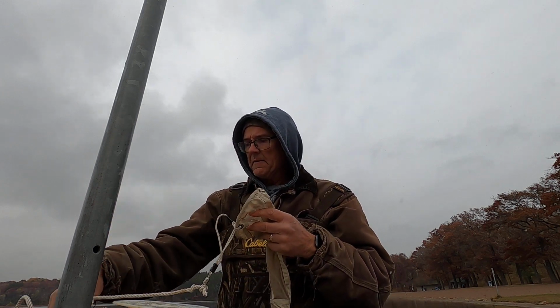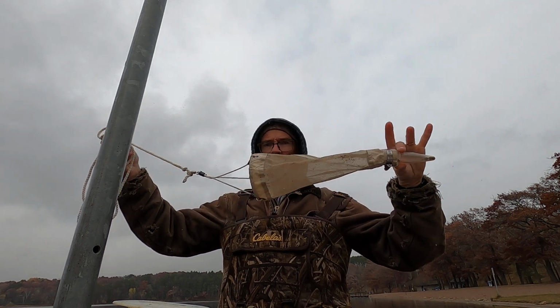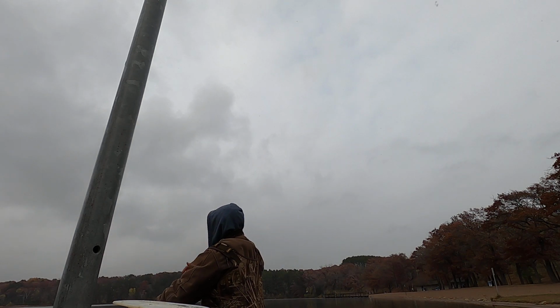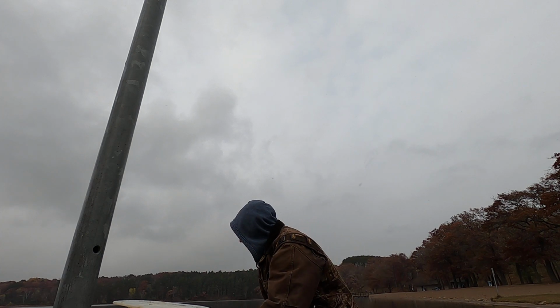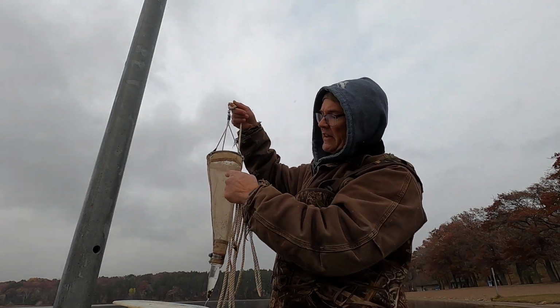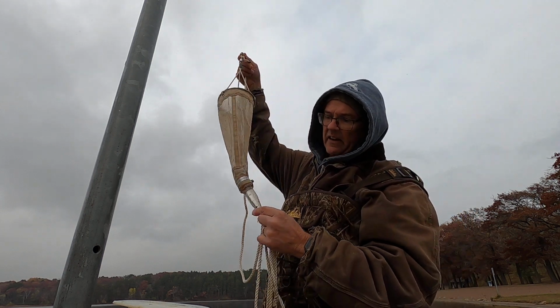The other thing we can do to look at what lives in the water is a plankton net, and that's what this is. So we throw this net into the water and we reel it in several times. And what's happening is every toss of this plankton net, the plankton get caught and they trickle on down the side of the net and get collected in this little vial here.